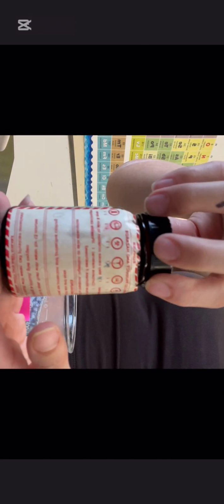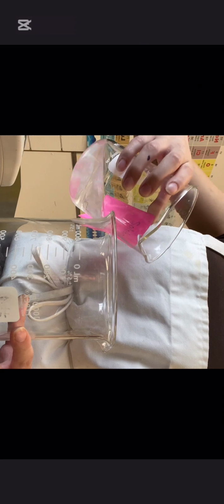Now I began to make my indigo carmine solution. I pushed tare on the scale to measure out a proper measurement. I used about 1 milliliter of my indigo carmine. This is when I began to put on my apron because it gets messy and it's very easy to stain your hands and your clothes. Now this is where I got help, and my teacher helped me make the solution. We just poured it back and forth to mix the indigo carmine, and we put about 100 milliliters of water.